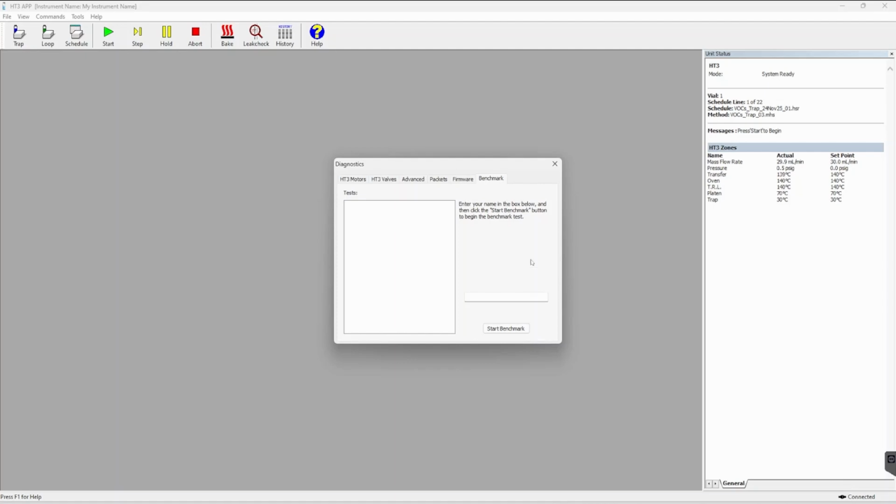Again, we just want to stress the Diagnostics tool is intended for advanced users or to be used by a service engineer, so ensure your training is up to date before you use this.